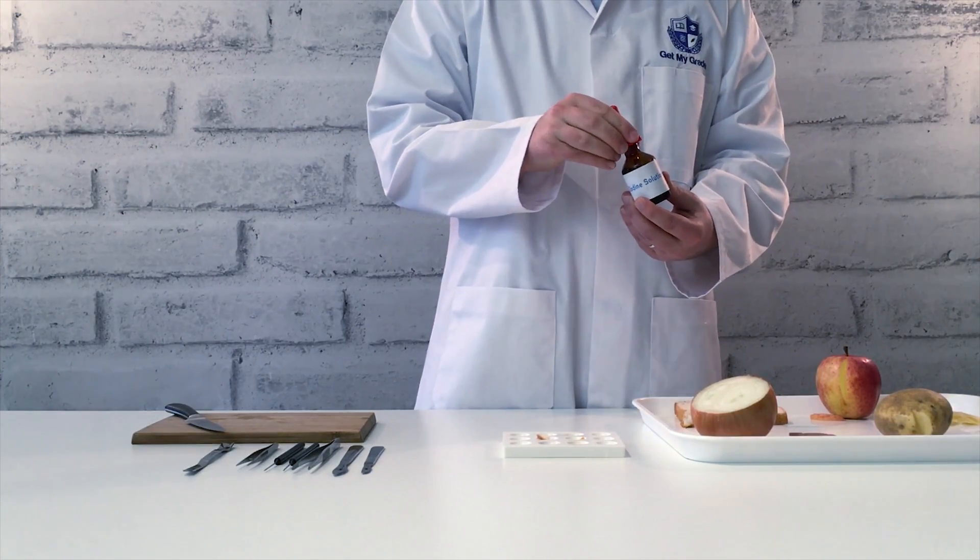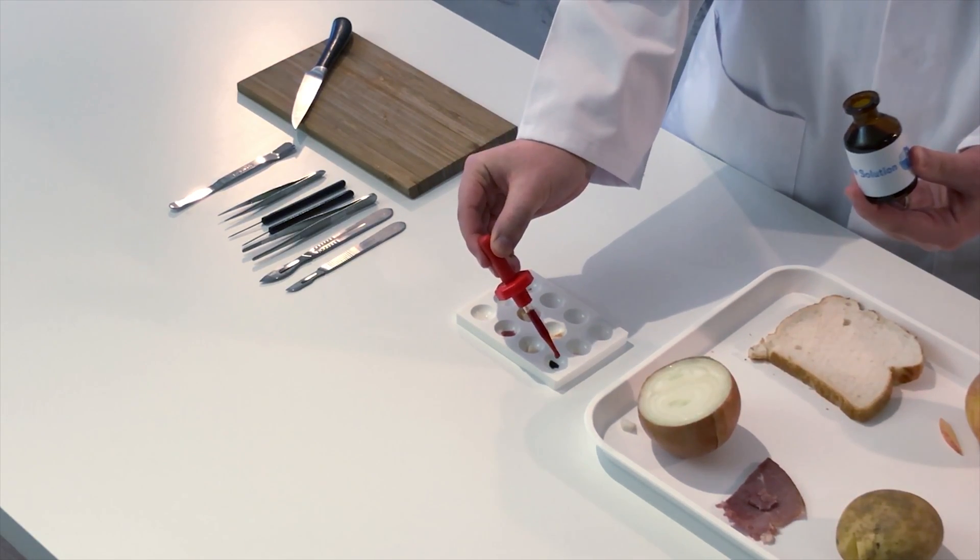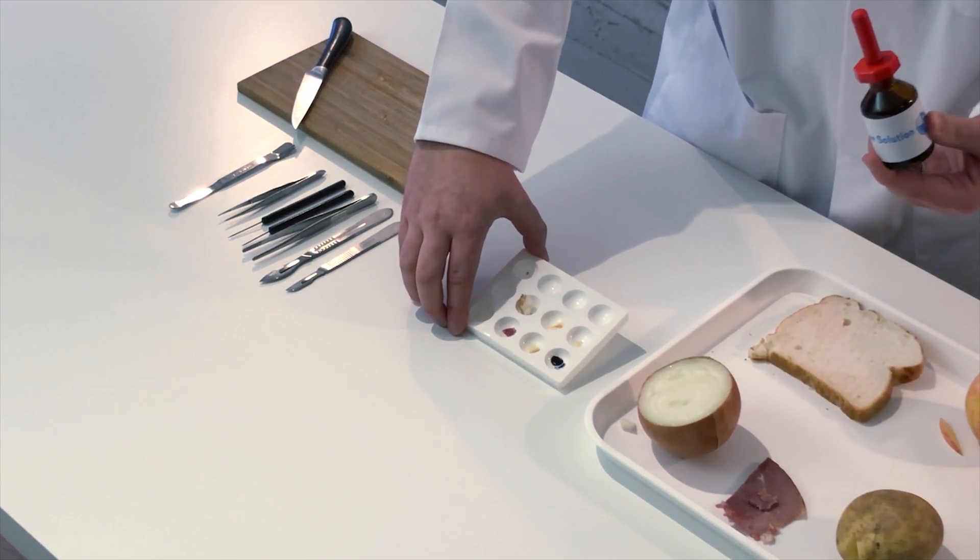So the first one is obviously starch, so we're expecting a positive result. Let's see what we get. One or two drops and you can see an instant blue-black color. Very nice and clear.